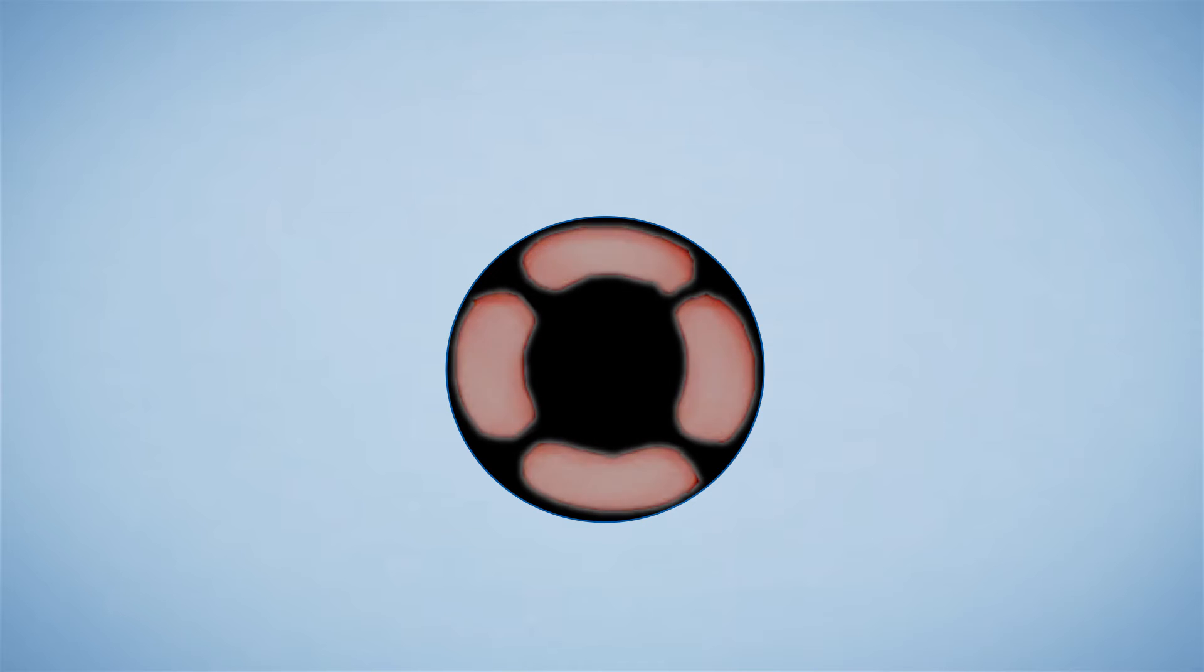The top mask will cover everything but the center of the sample. So you will shine the beam to the sides and read the temperature in the middle, basically looking at the in-plane flow of the heat.